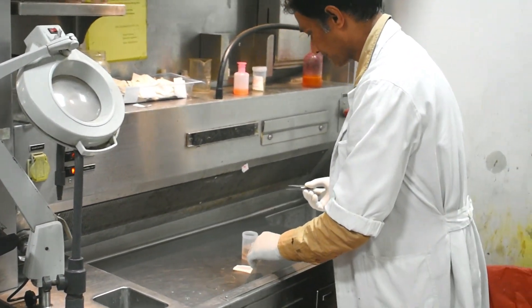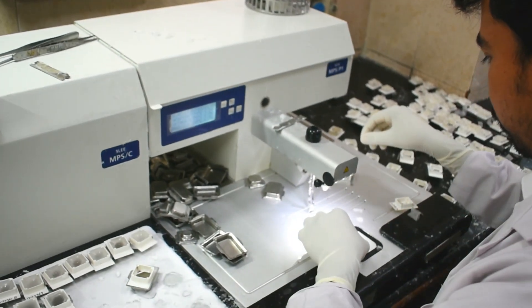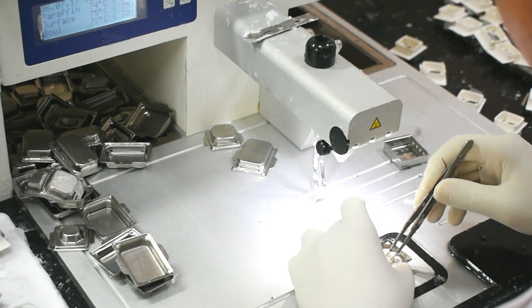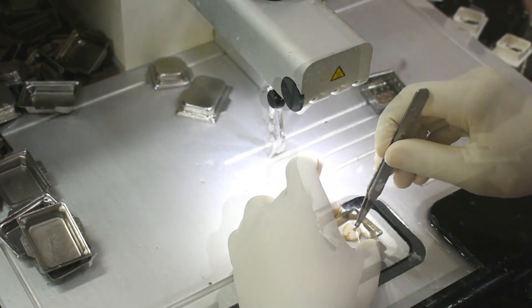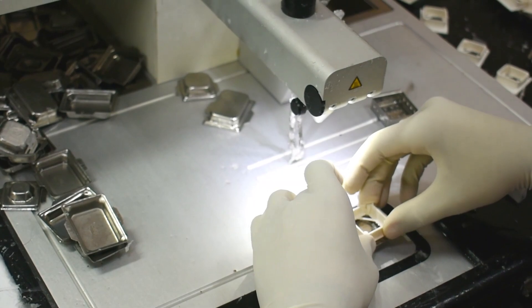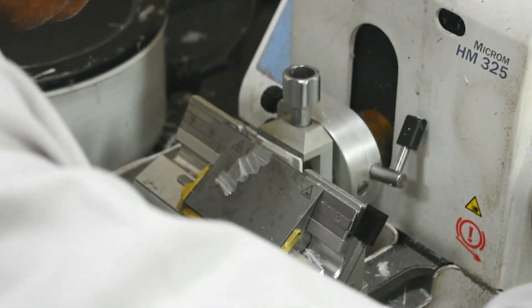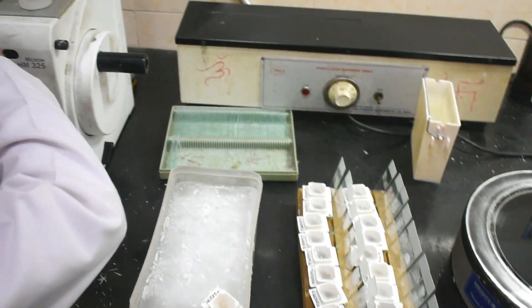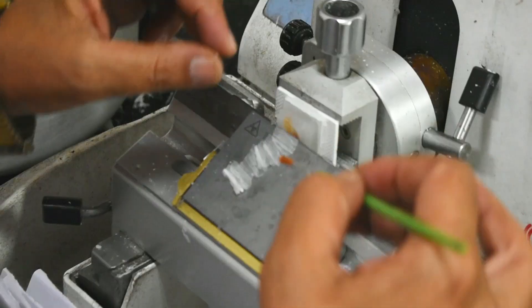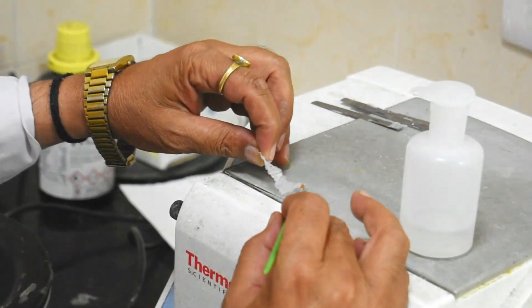Laboratory diagnostic tests performed by the laboratory technologist detect the type and grade of cancer. Cancer is usually clear when the cells are seen under the microscope after routine histopathological processing and staining, in which the cause, mechanism of development, structural alteration of the cells, and the clinical manifestation is revealed.